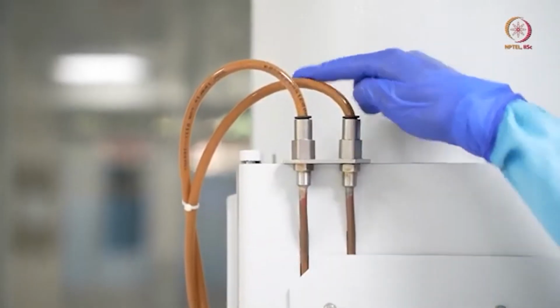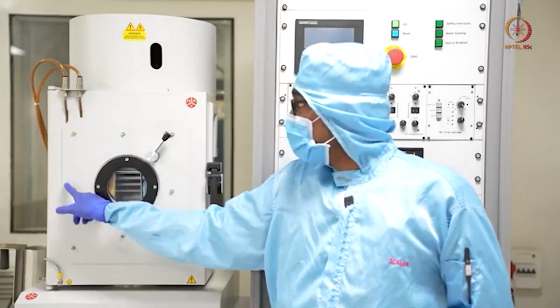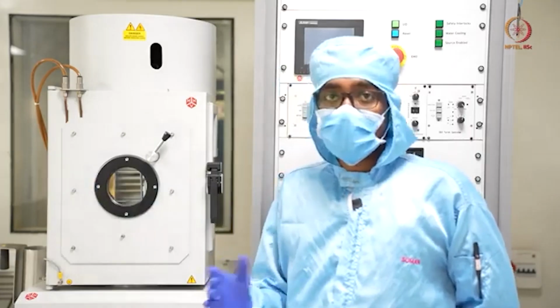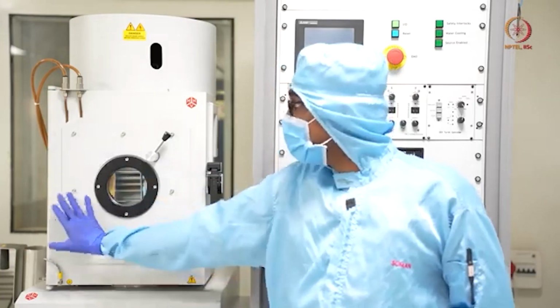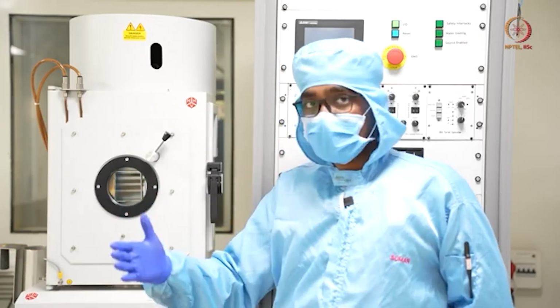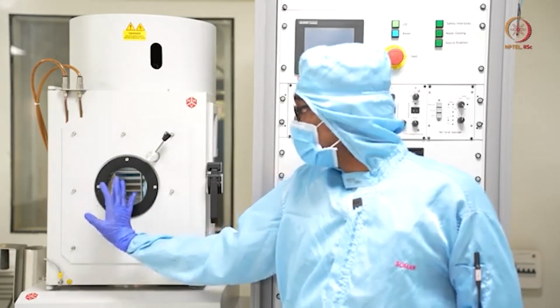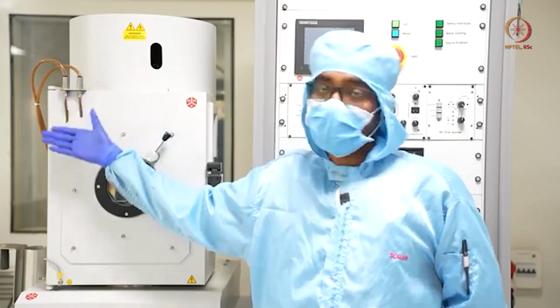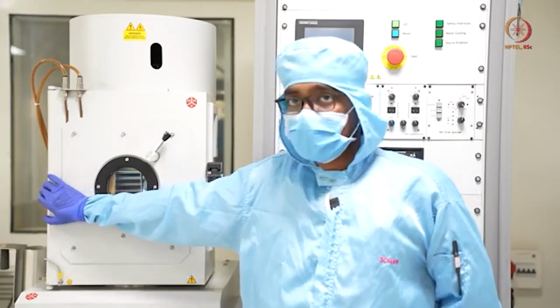Here you can see there are two pipes coming. These are water pipes, connected to the chiller. One of these supplies cold, chilled water, and the temperature will be around 19 to 21 degrees C. It will flow inside as well as outside, and we will show that later on. The connections are everywhere, inside and outside, so it is used as a coolant. Whatever heat is generated inside will be dispersed, and using the other pipe we maintain a flow of water so that we can cool down the tools inside as well as the chamber.